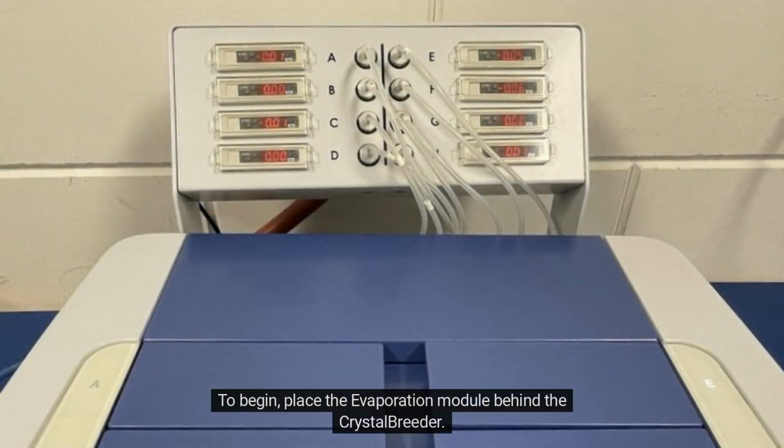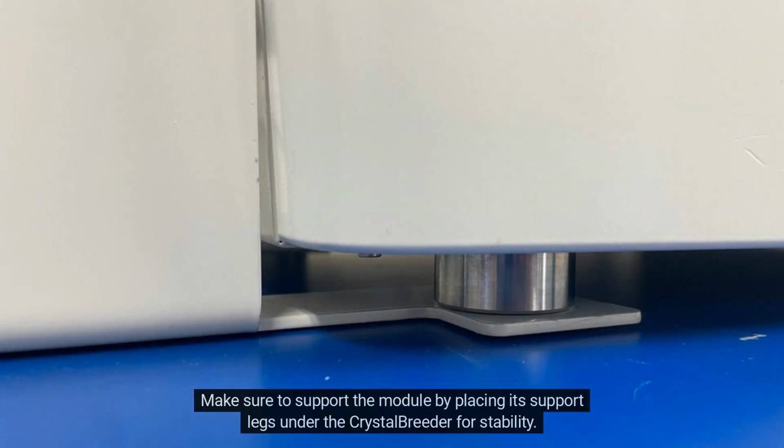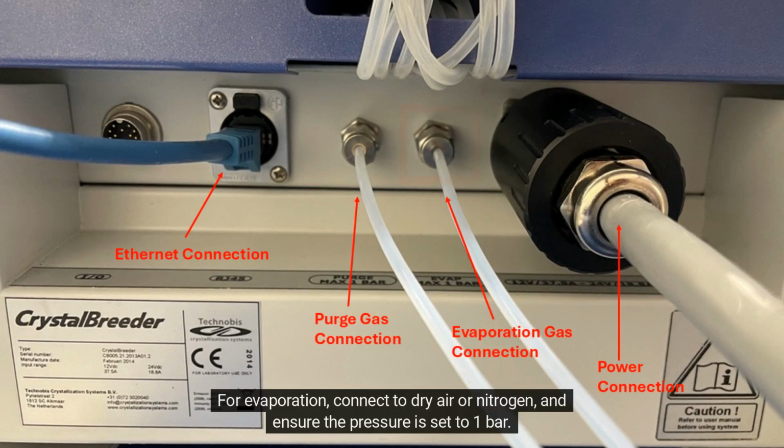To begin, place the evaporation module behind the CrystalBreeder. Make sure to support the module by placing its support legs under the CrystalBreeder for stability. Connect all the connections at the back of the CrystalBreeder. For evaporation, connect to dry air or nitrogen, and ensure the pressure is set to 1 bar.